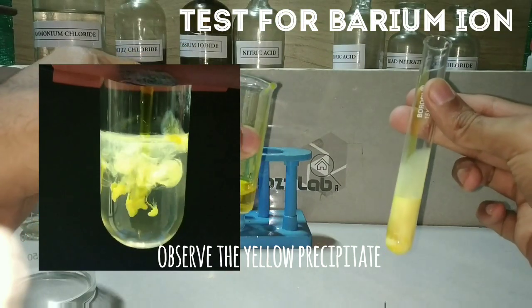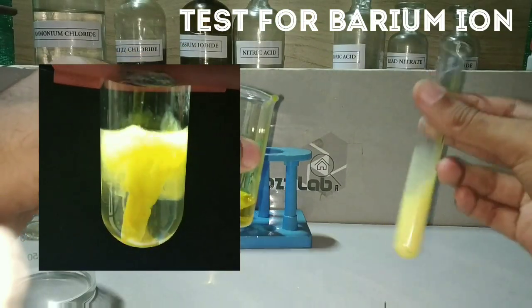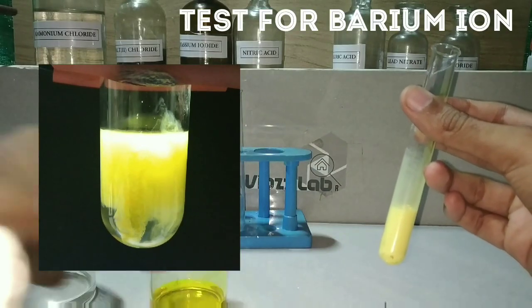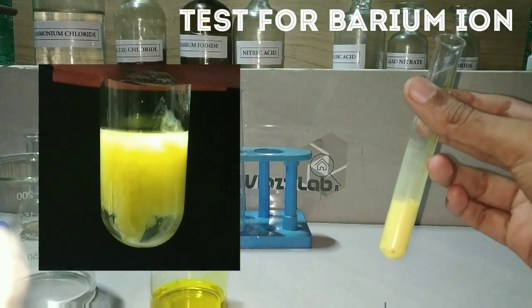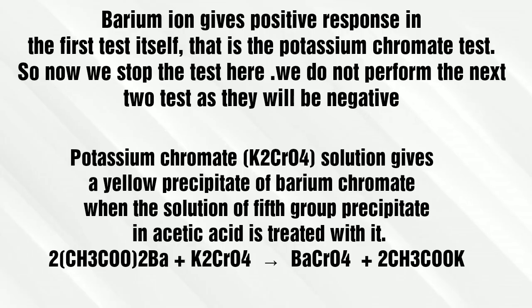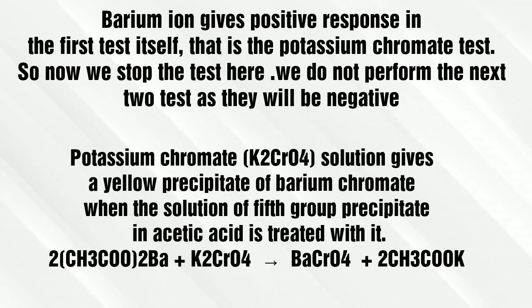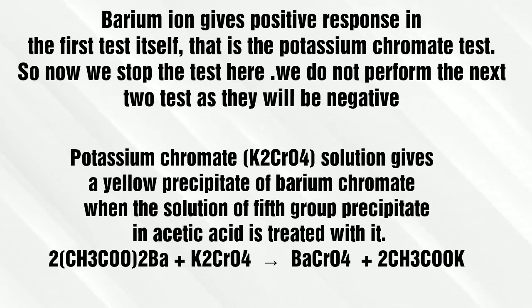On adding potassium chromate, there is formation of a bright lemon-yellow colored precipitate. Since we got a positive result, we will not be doing the second and third tests for this sample. The barium ions reacted with potassium chromate forming the yellow precipitate of barium chromate.